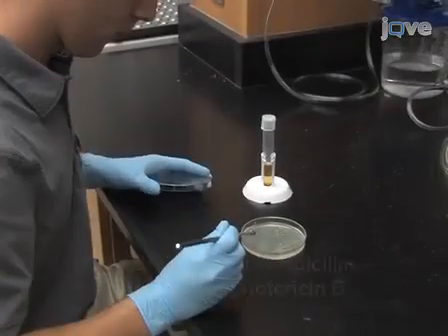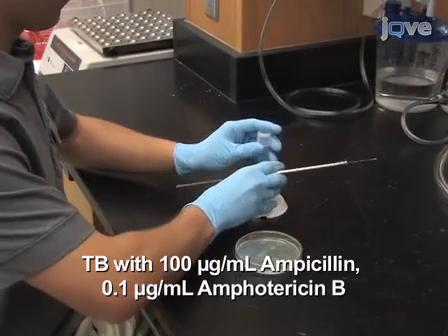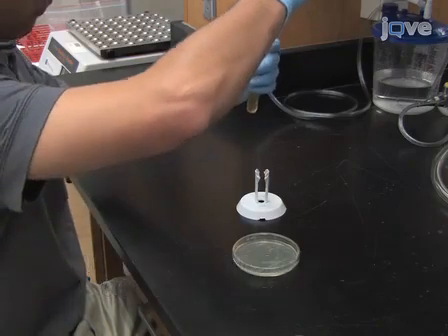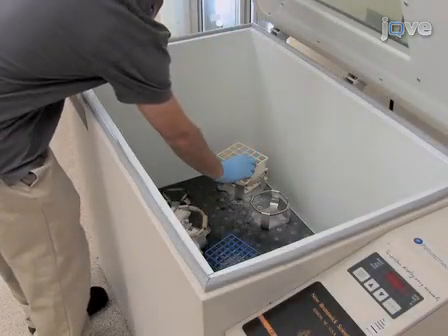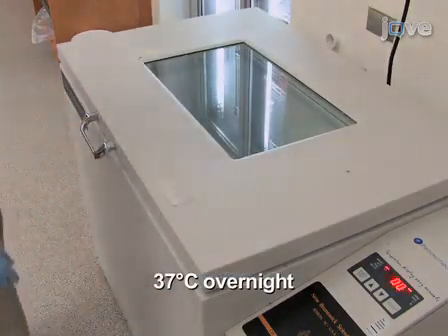To prepare feeding bacteria for C. elegans, begin on day -7 by inoculating 5 ml of TB containing 100 micrograms per milliliter ampicillin and 0.1 micrograms per milliliter amphotericin B with a single OP50 colony. Incubate overnight at 37 degrees Celsius in a bacterial shaker.